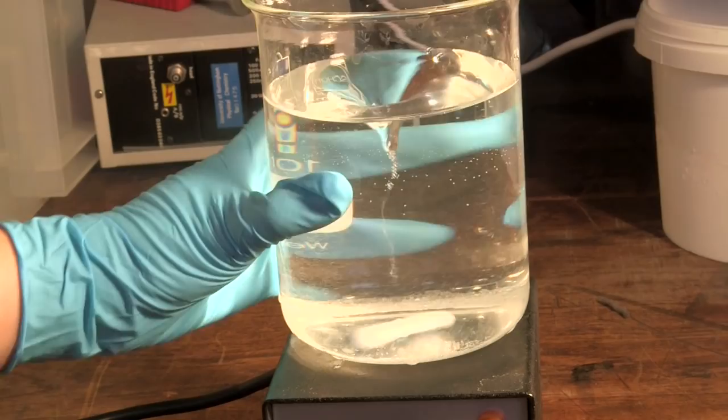My colleague Sam wanted to show you a really interesting reaction, the so-called Belousov-Zhabotinsky reaction, which oscillates. The color changes on and off. Sadly, she's lost her voice, so she's done the experiment, but you're stuck with me to tell you what's happening.